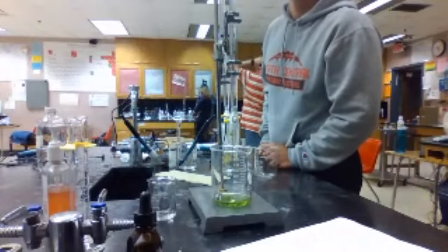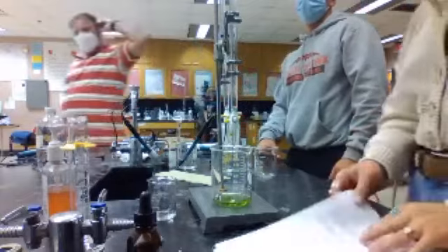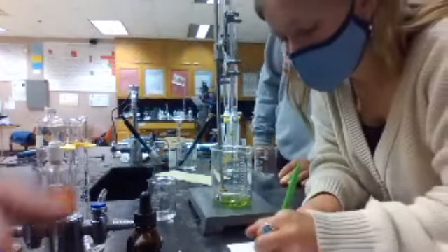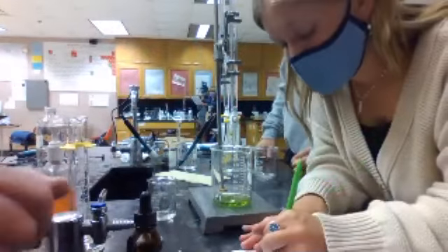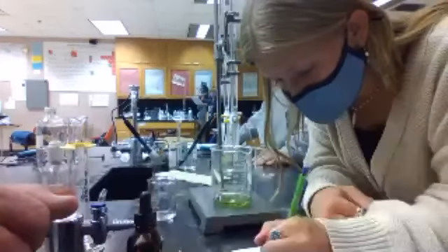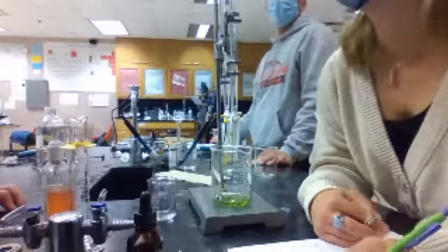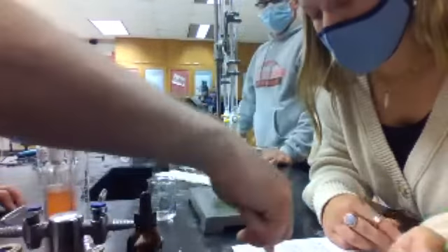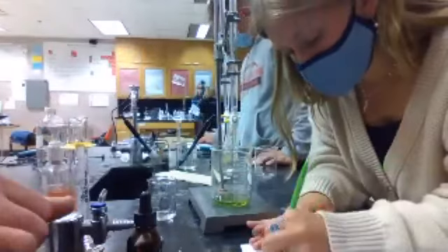Okay, but I'm confused because that's the final volume of the base, but we already found the final volume of the base. Well, no, we didn't. We found what might be the final volume of the base. Their estimated volume was 7 something, right? So we found experimentally that it's more than that. Okay, 7.84. So this was 7.84, and this is the final volume of the base. Oh, but this is the actual volume. We define the actual volume: we take this minus this, final minus initial.